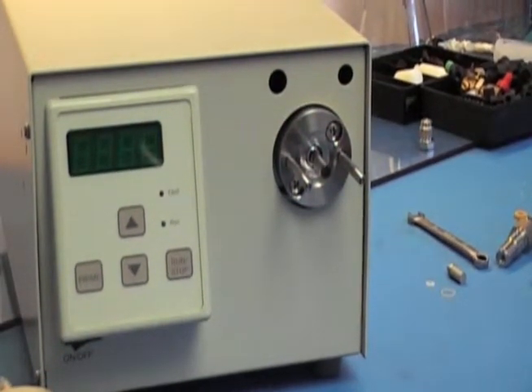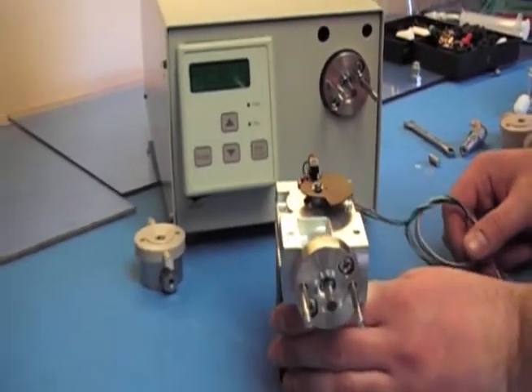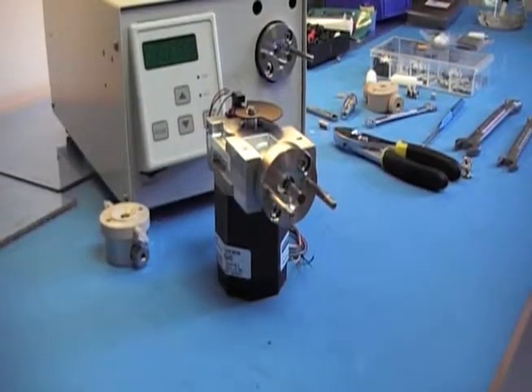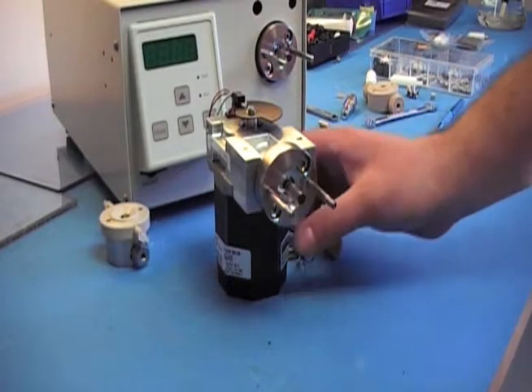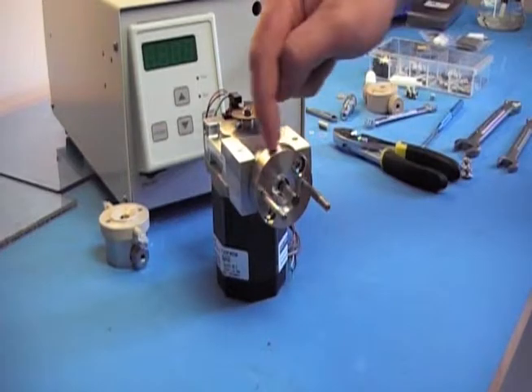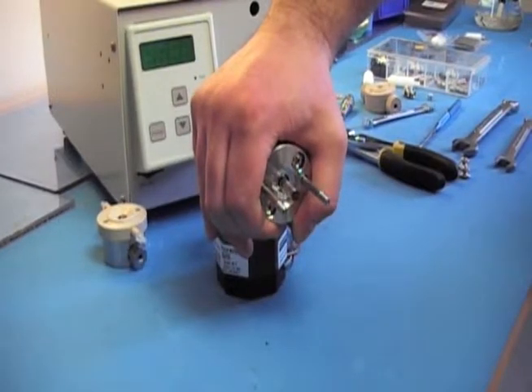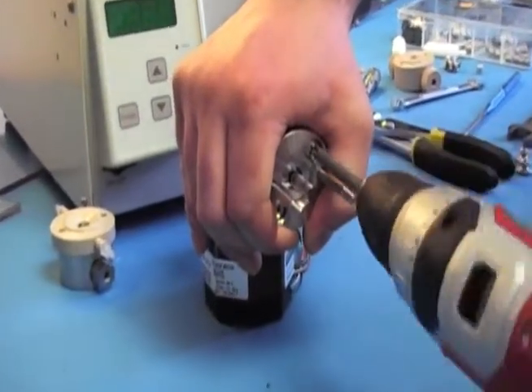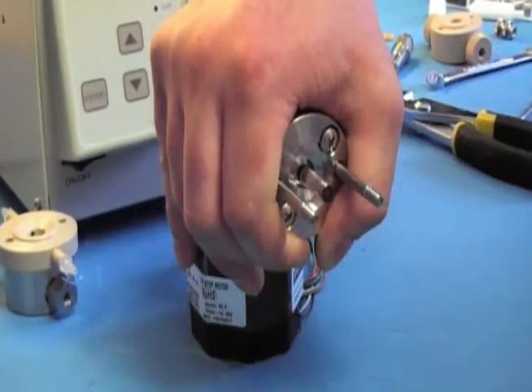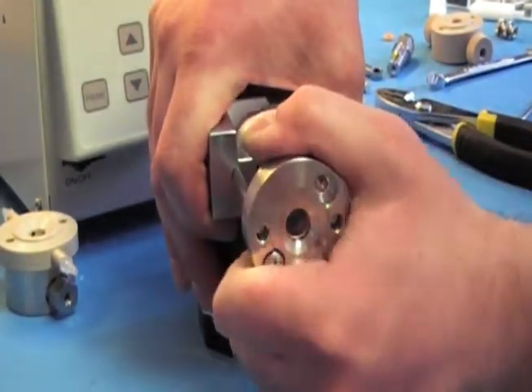We're going to switch to a mechanism that is not attached to the shell. After you remove the self flush, you'll see two screws on the front of the piston retainer. You want to hold it because there's a spring behind it. Take out both of the screws. If it sticks and doesn't pop out by itself, that's okay — go ahead and give it a little tug.